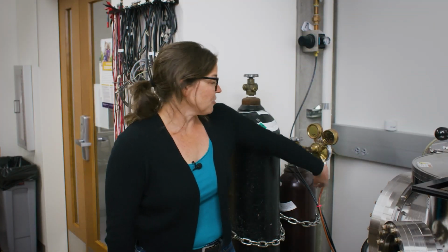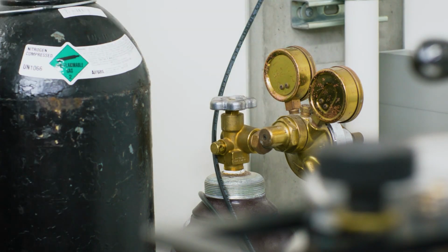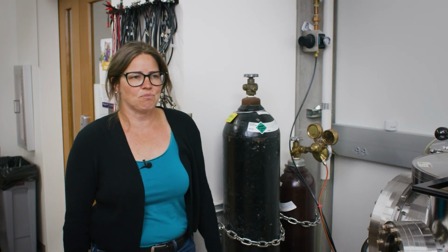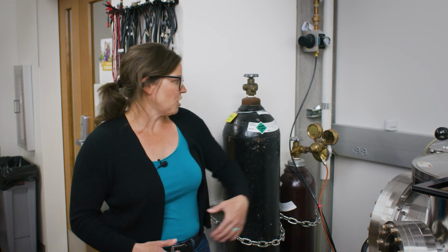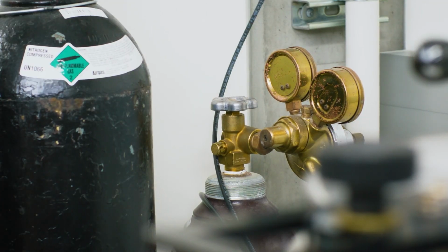Okay, so the gas bottle that we've used for our argon is here. When we came in, I mentioned that you had to turn on the gas. We turn it on here, and then otherwise everything is ready to go, and the computer will drive the actual gas flow. When we're done for the day, we want to make sure we close this valve again so that way we don't accidentally run our gas bottle of argon dry.